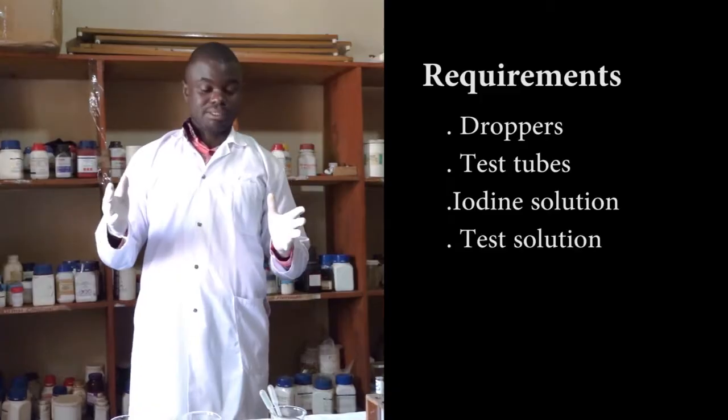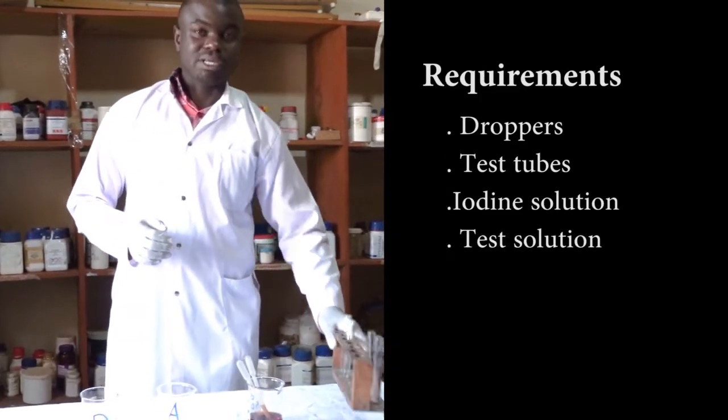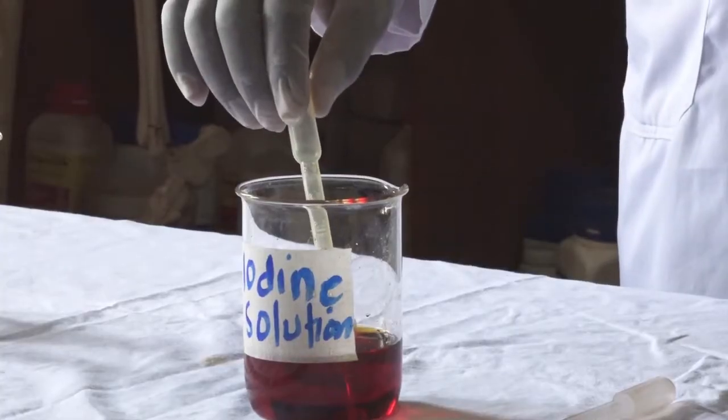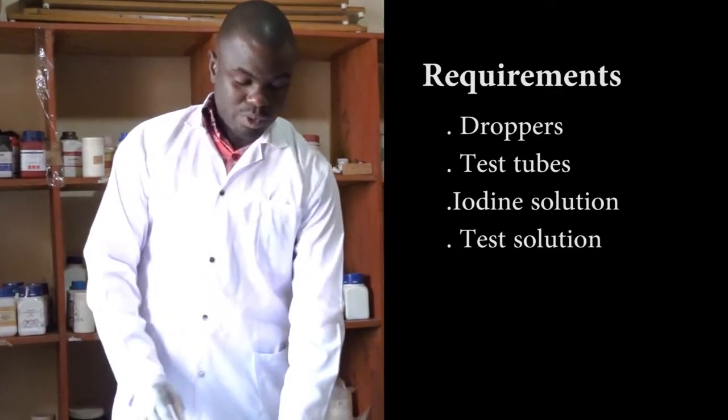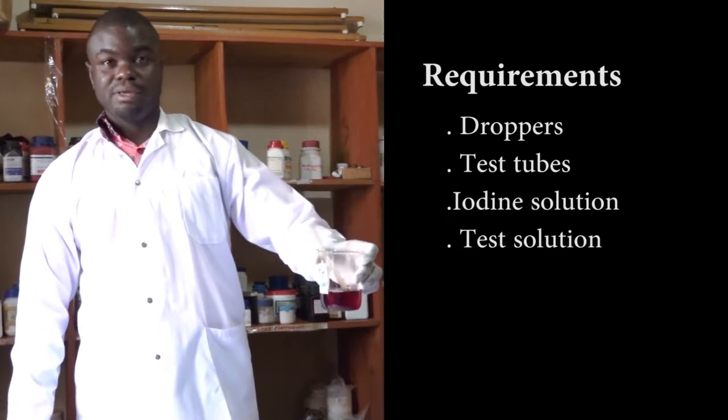So what do we need? We need test tubes and I have some here. We need a dropper and I have one here. We need iodine and I have some here.